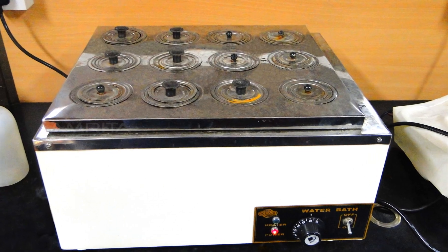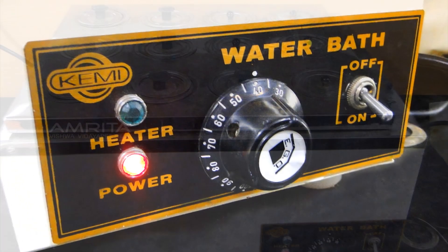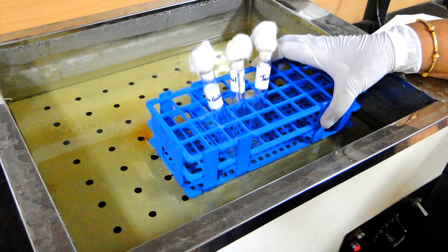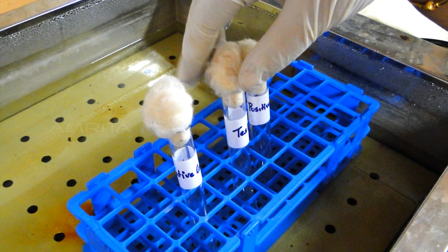All these tubes are incubated in a water bath maintained at 37 degrees Celsius, and suspensions are observed at half-hourly intervals for a period of 4 hours.